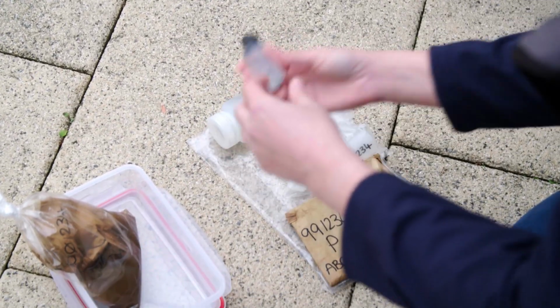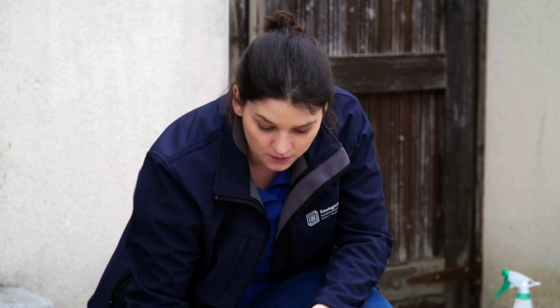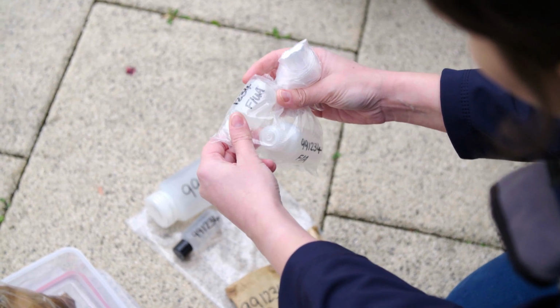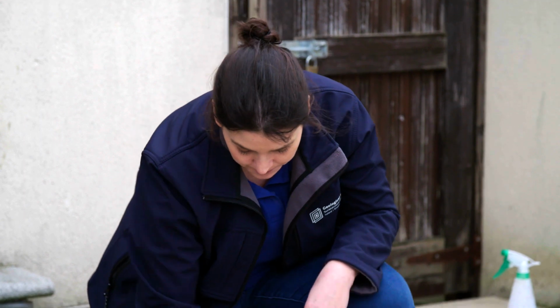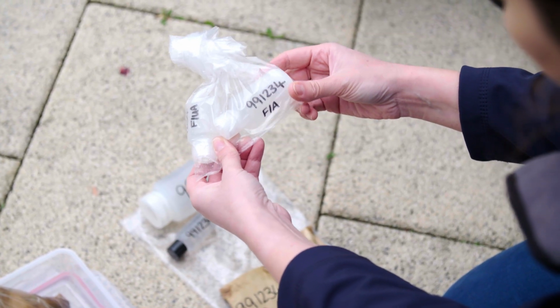Ensure that they contain no air, are not leaking, and are labelled with the 6-digit site number only, written from the cap down. Leave the FA and FUA filtered water bottles in their loosely knotted polybag. Ensure that the larger 60 milliliter bottle is correctly marked FA and filled to the base of the neck. Ensure that the smaller 30 milliliter bottle is marked FUA and contains a minimum of air.